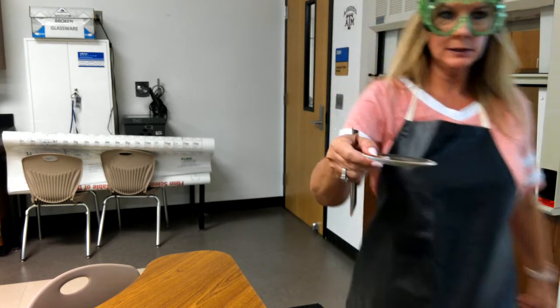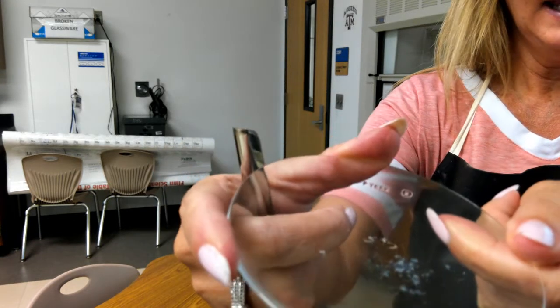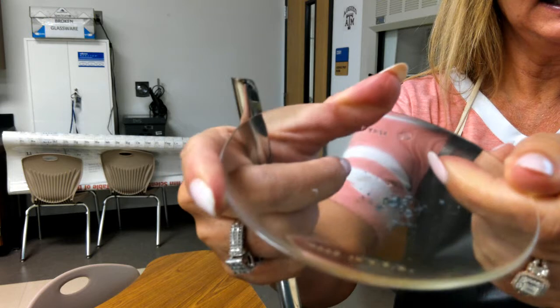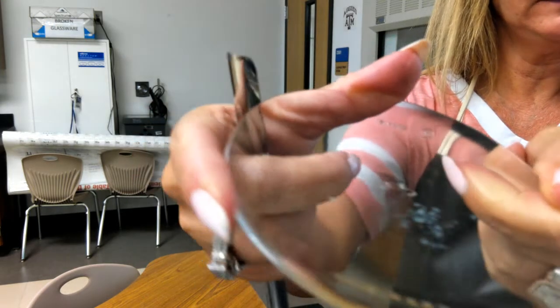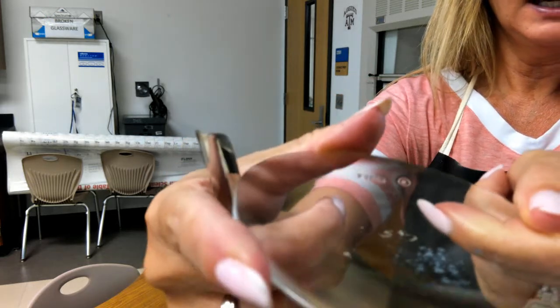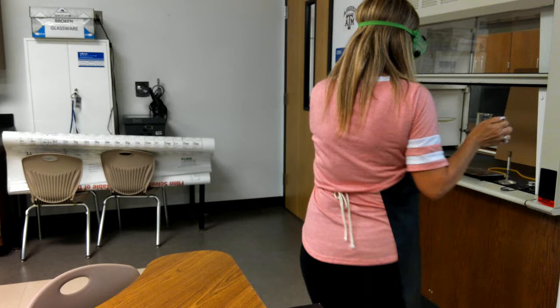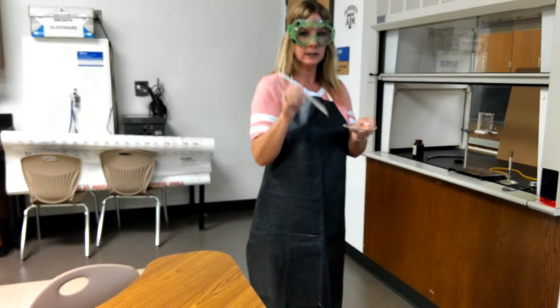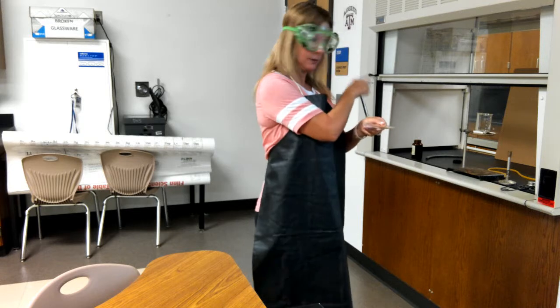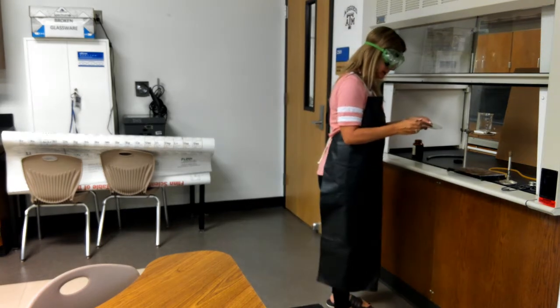Okay, so here's what it looks like to start with, because remember, you're supposed to see how it changes. And it is a grayish solid with a little bit of sparkle to it. I'm not sure if you can see that on the video. So that's what it starts out as. Now, when it turns to vapors, it's pretty toxic. So that's why I have to do it over here in the hood. And I'm also only going to use a little tiny bit.